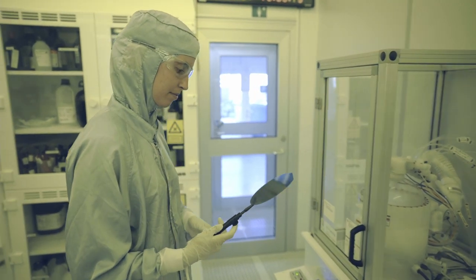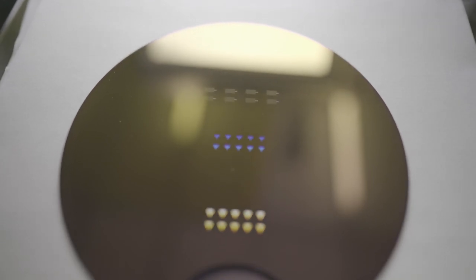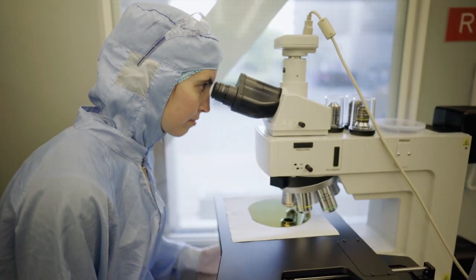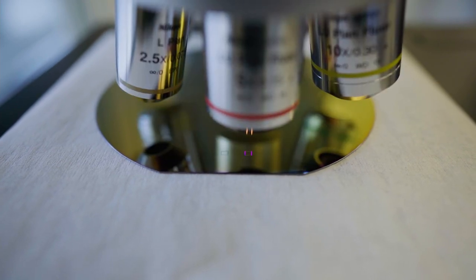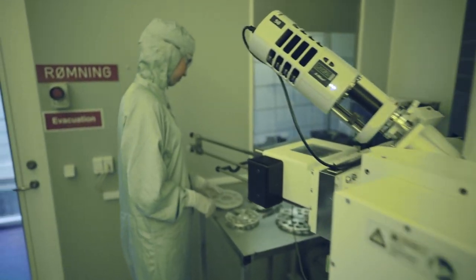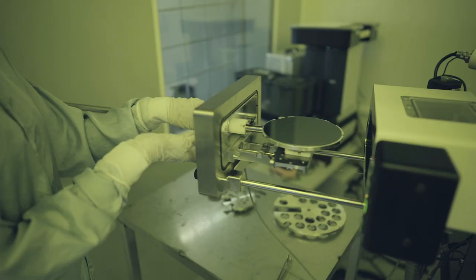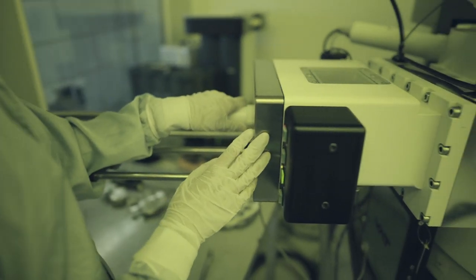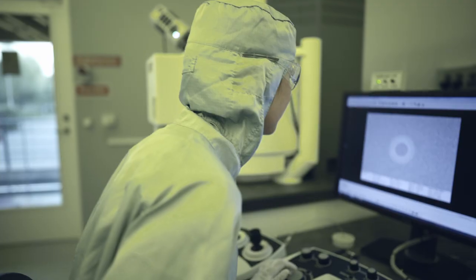At this stage, the pattern is visible and the substrate can be viewed under a microscope as an initial inspection. Most patterns defined by EBL will naturally have geometry that is not sufficiently visible in optical microscopes and hence one often has to use a scanning electron microscope to characterize the result of the process. The substrate is placed on a suitable holder and gated through the load lock into the scanning electron microscope vacuum chamber where it can be imaged and analyzed.